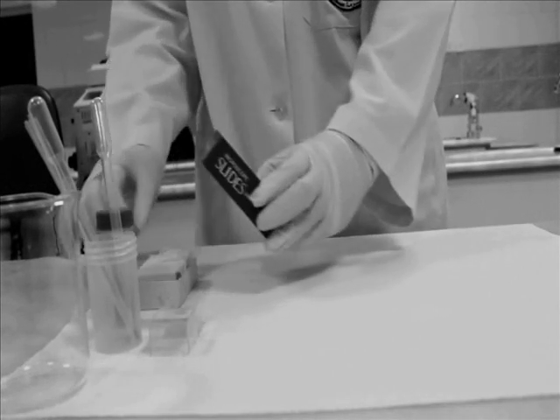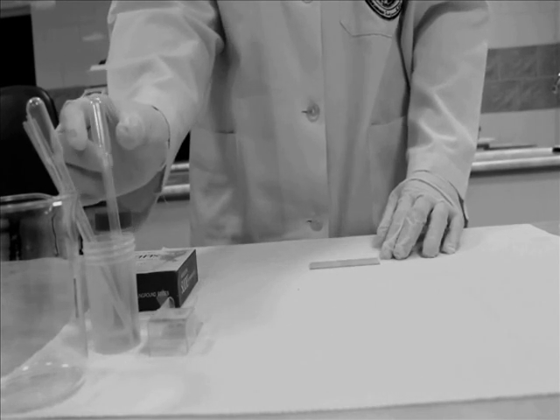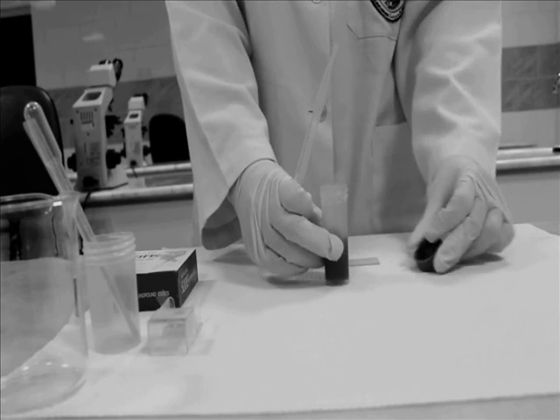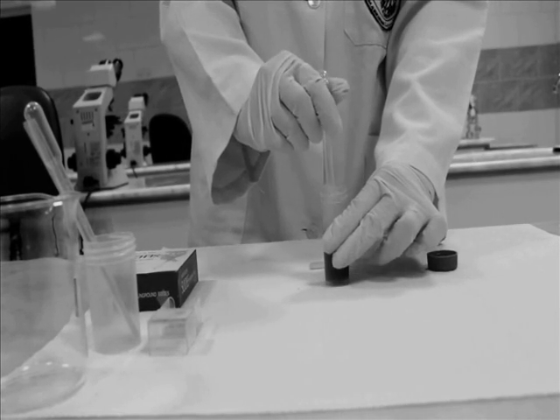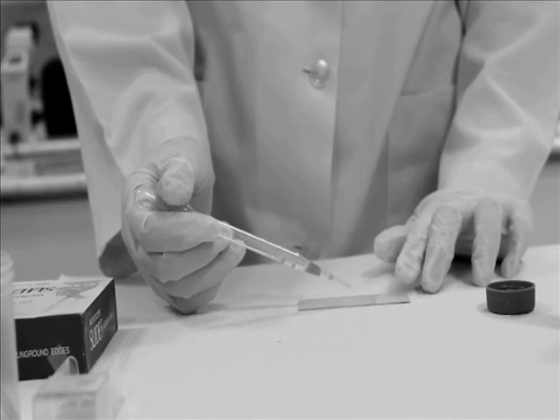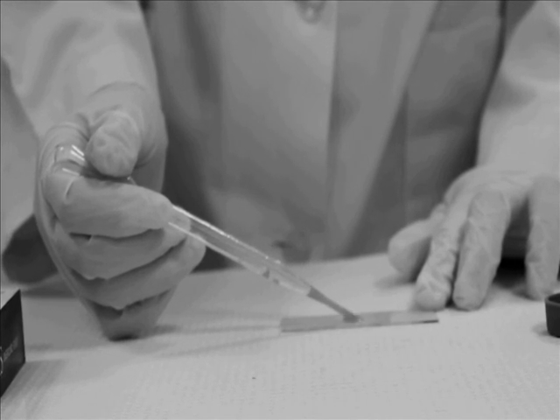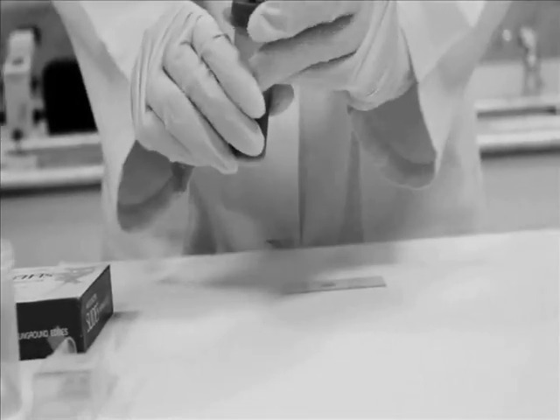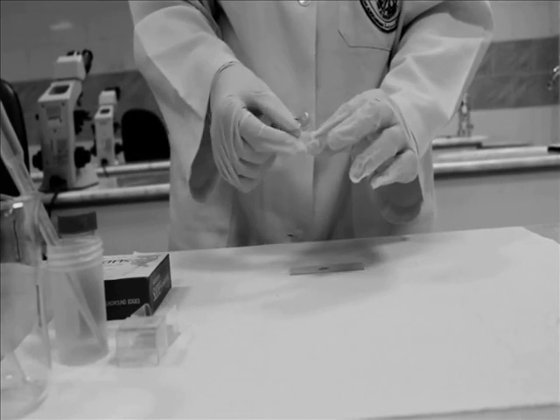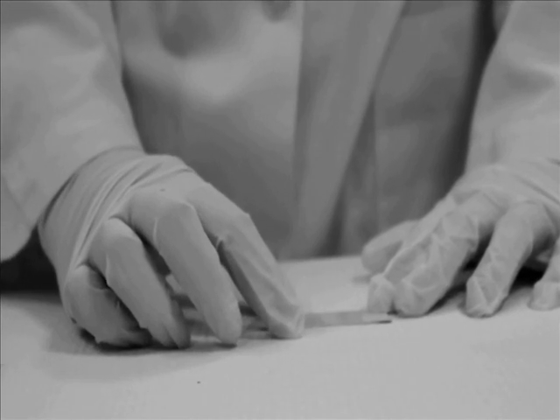First, we take a microscope slide and place a drop of stool. And because the sample is liquid, we don't need to add an iodine solution or normal saline. Then place the cover slip on the slide and avoid air bubbles.